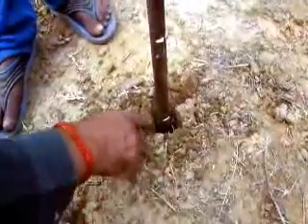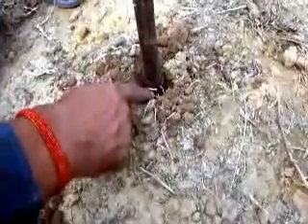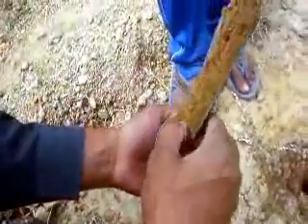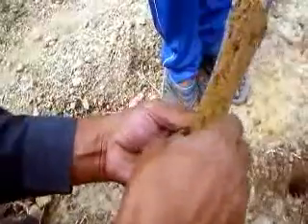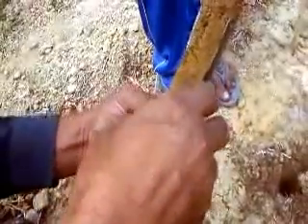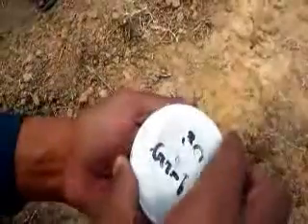So now it has reached 30 centimeter, sorry, and we need to take the sample from here and collect it in this box, just a few grams of soil to get the soil moisture at 30 centimeter. It is sufficient. So this is the sample to find out soil moisture at 30 centimeter.